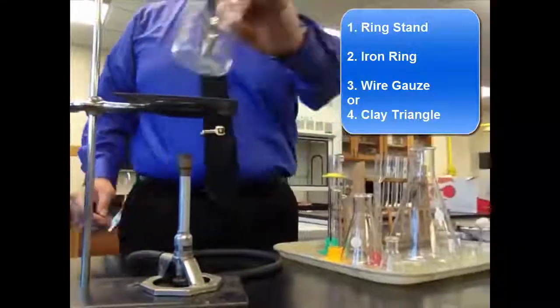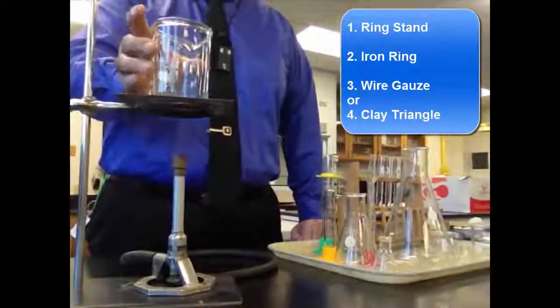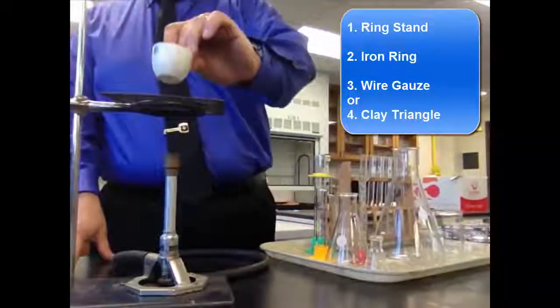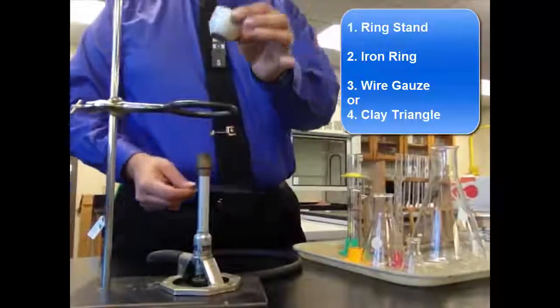And then I can put my beaker on top of that and I can heat it nicely. So that's one way that I can heat things. If I want to heat a crucible up on my little oven top, I can do this, but there's probably a little bit easier way and better way to heat a crucible.